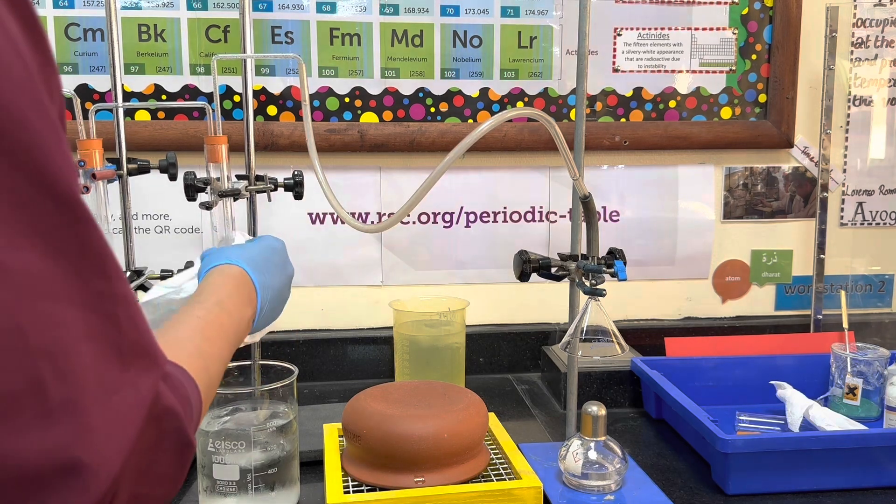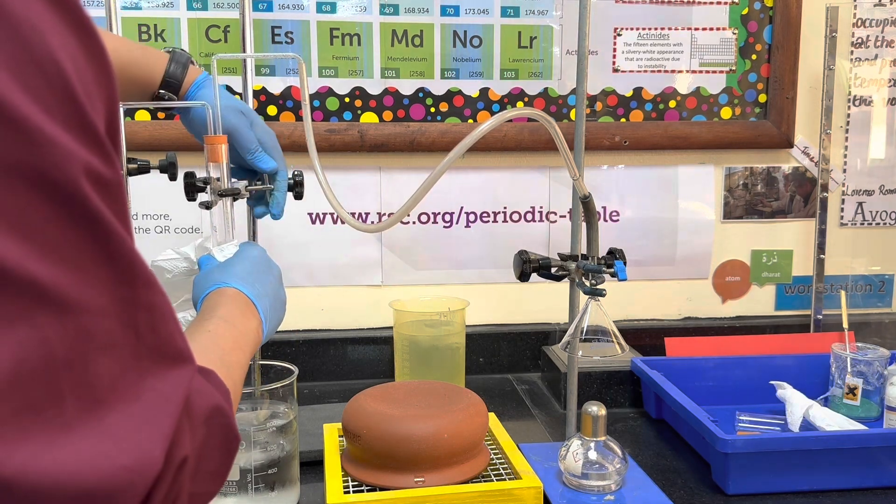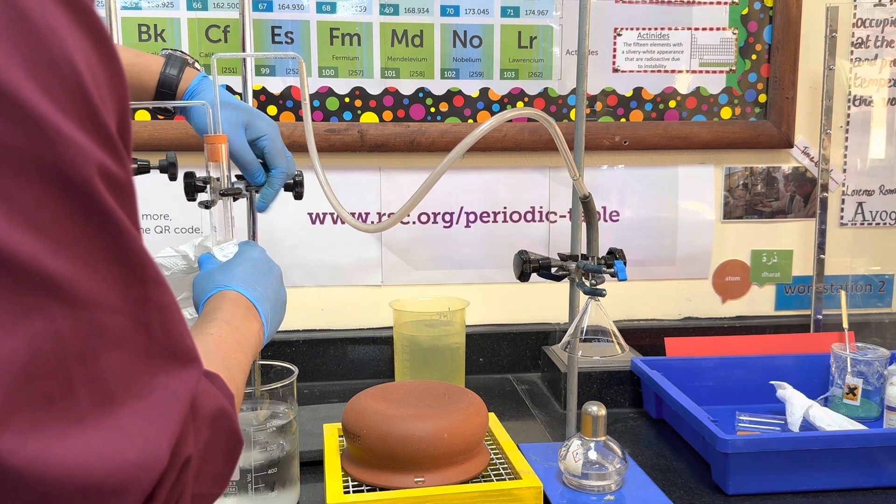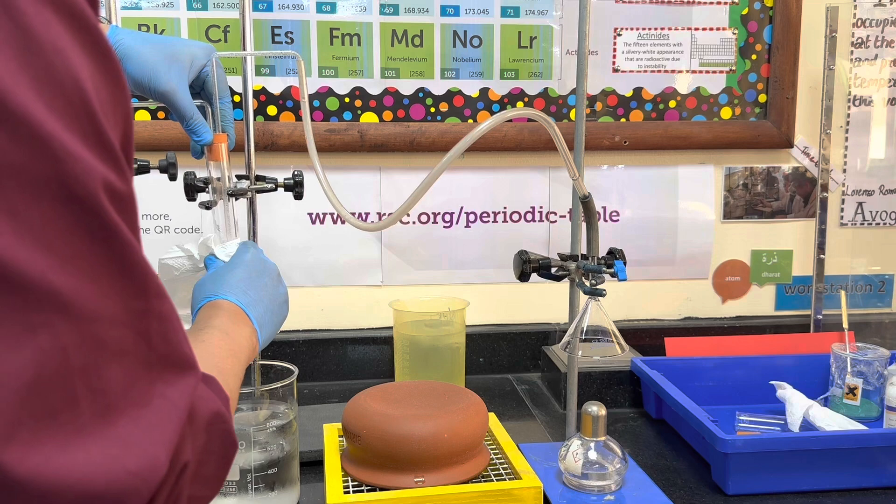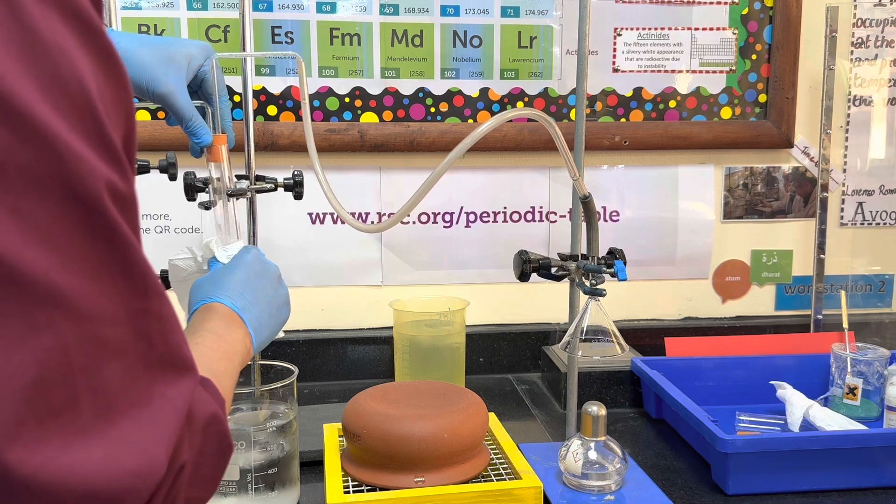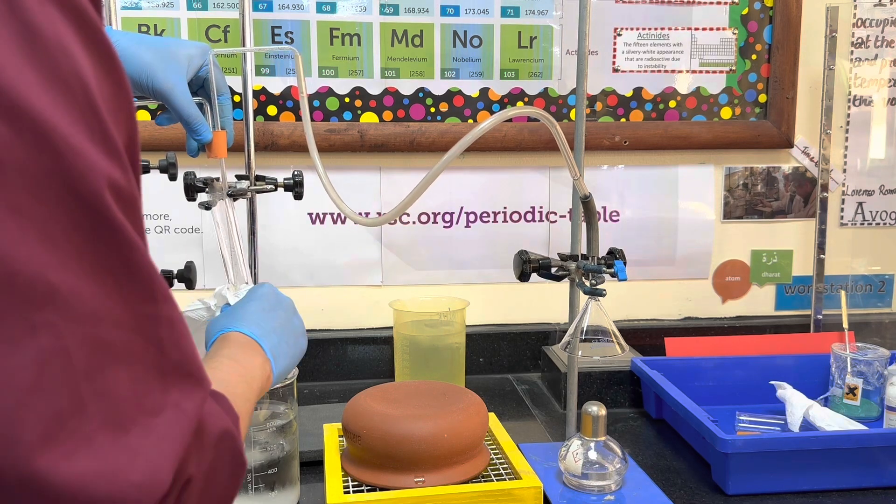With a paper towel, as you can see, this is to demonstrate that the colorless liquid that forms is actually forming on the inside of the boiling tube as a result of being one of the cooled-down products of combustion.